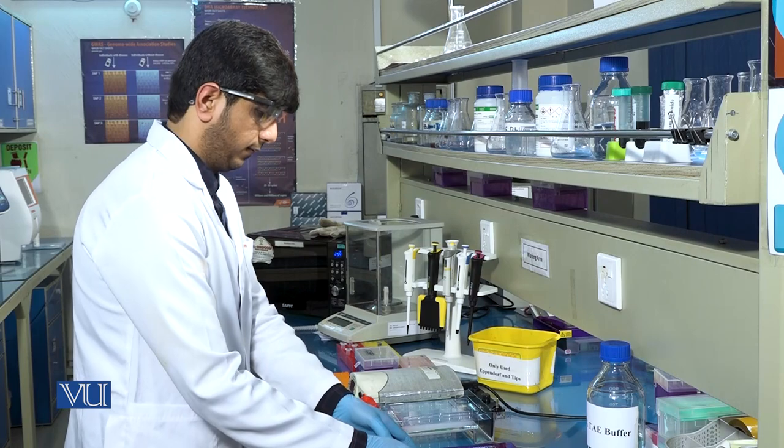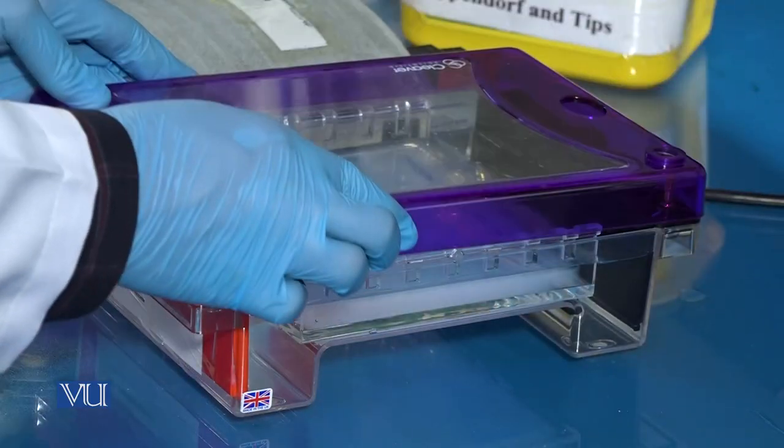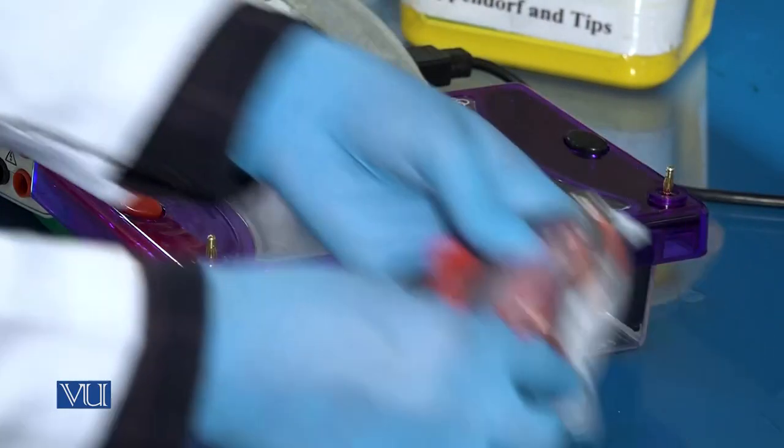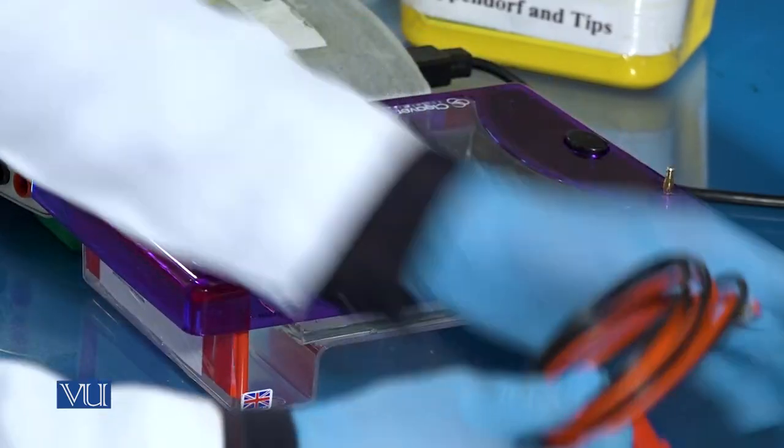After gel loading, cover the tank, plug in the electrode and turn on the power supply.